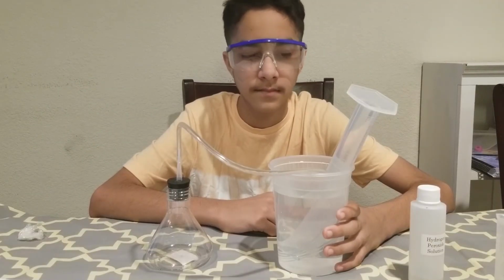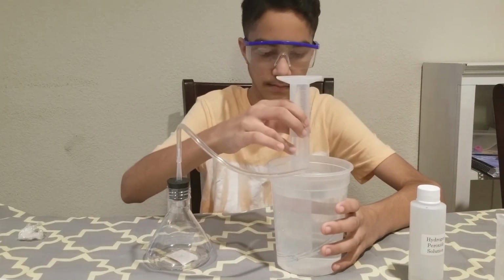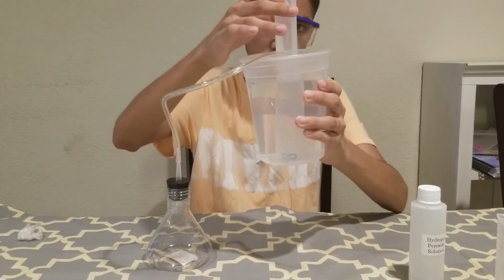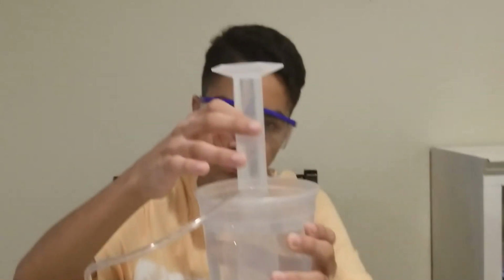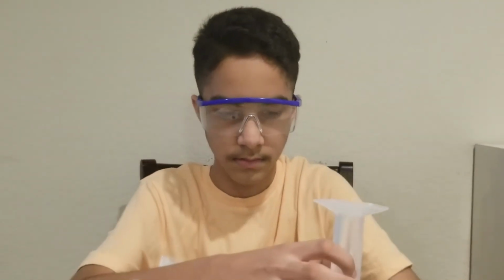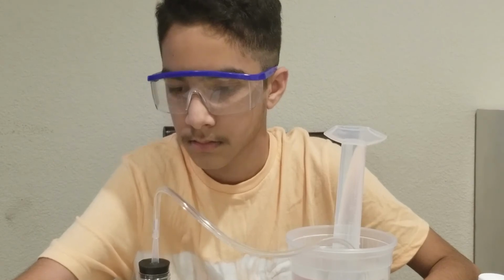Next, we are going to take the initial volume of air in the cylinder. To do that, Shahyan, hold the cylinder vertical, straight, and see if there is any air volume in the cylinder. And you guys can see that there is actually no air in this. So if no air, then Shahyan, go ahead and write down the reading as 0.00. Sorry, from the 100 ml cylinder, it will be 0.0 ml.